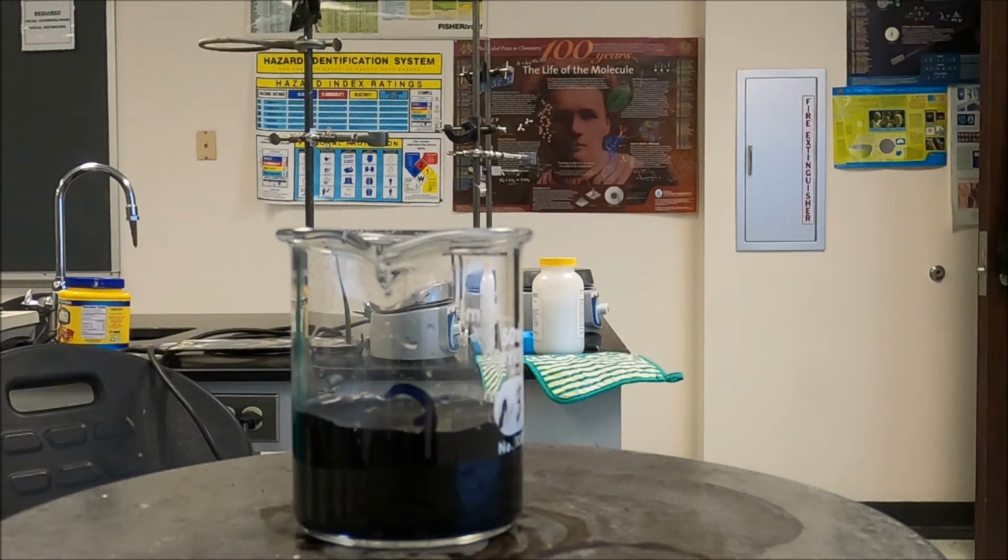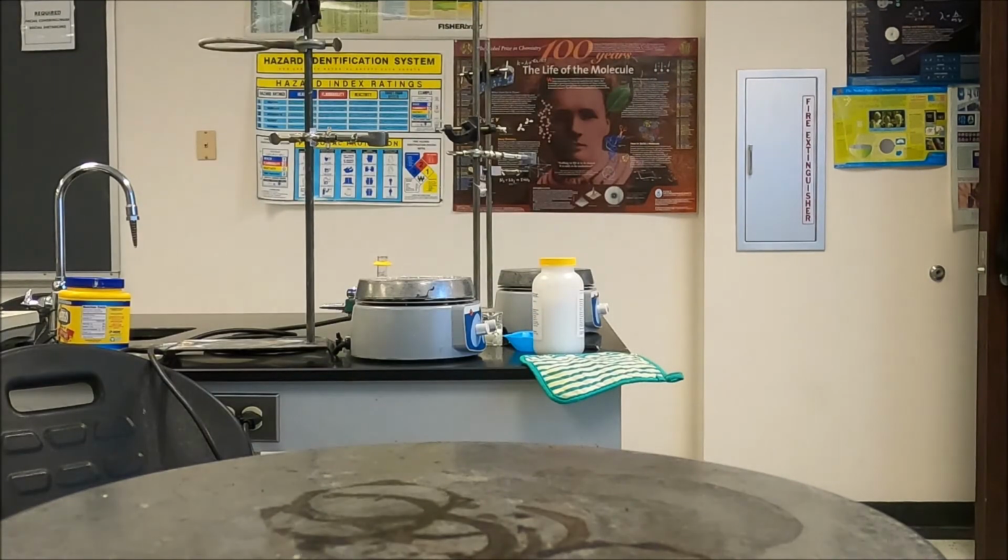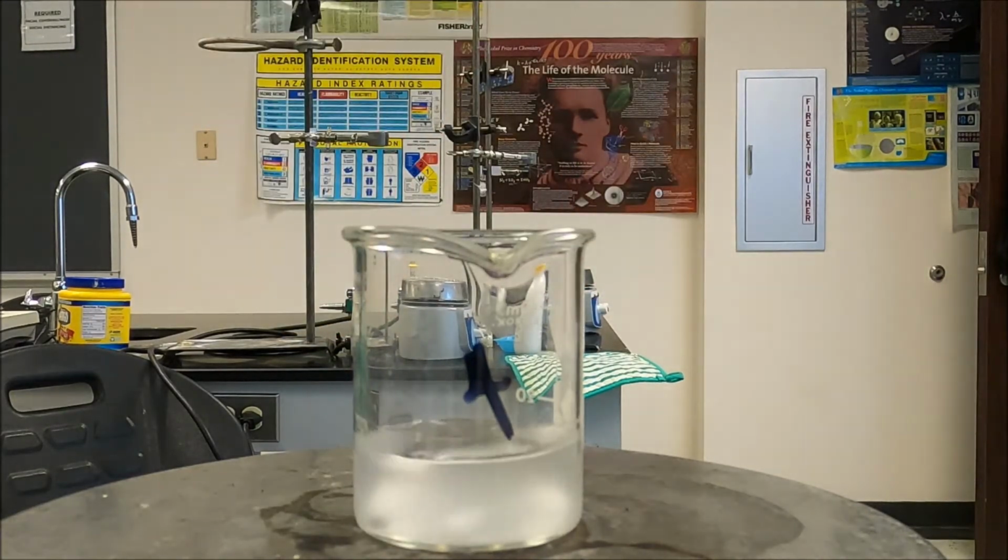Next one's 5, right? 12 mils. Yeah, next one's 5. Okay, here's beaker 4. Now guys, if you miss timing this, you can rewind the video and watch it again. Okay?